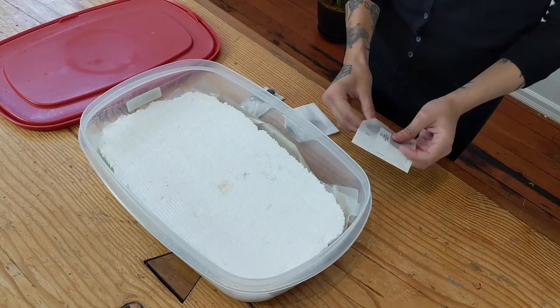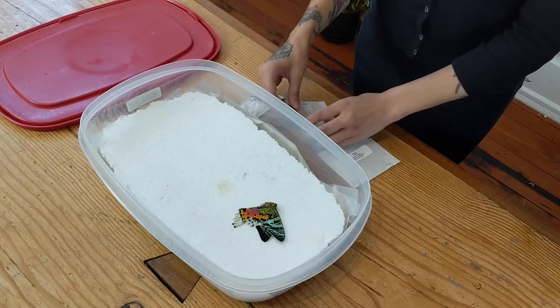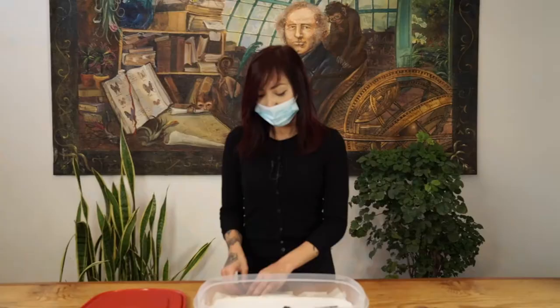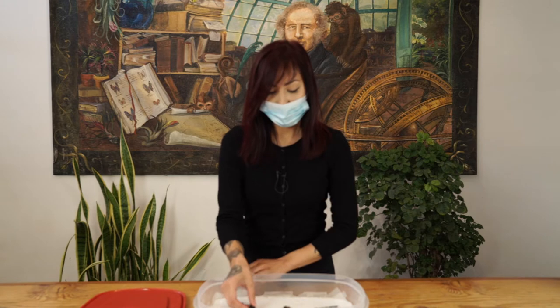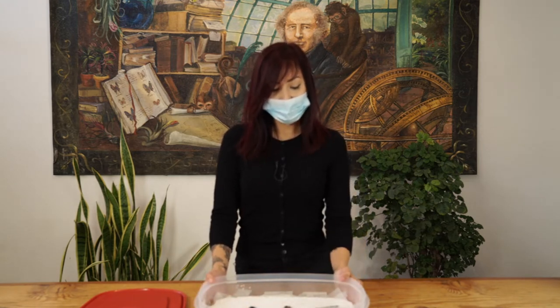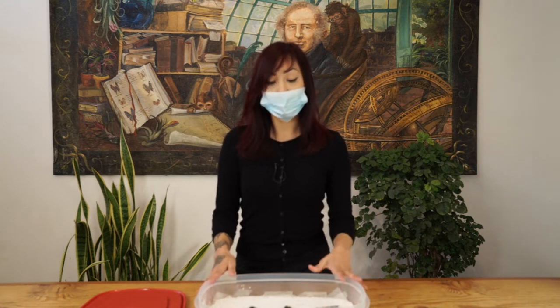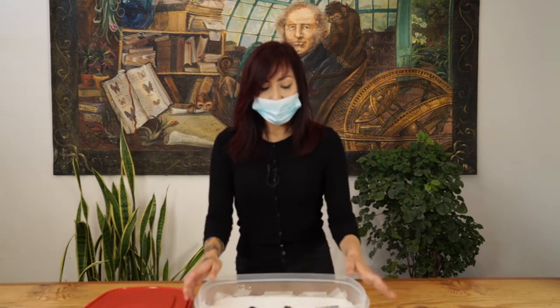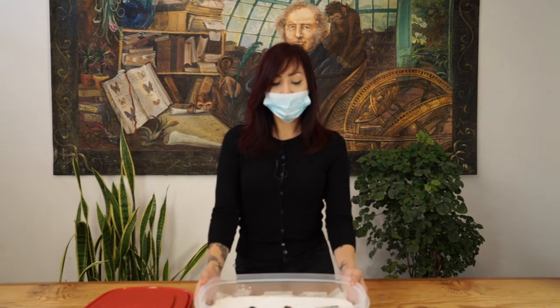Once you have that set up, you will need to remove your insects from their envelopes and place them on top of your styrofoam, never submerged in the liquid. The isopropyl alcohol is actually helpful in that it prevents any mold from occurring inside. Once you have all of that going, you will need to leave your insects alone for three to four days or up to a week, depending on the size of your insect.